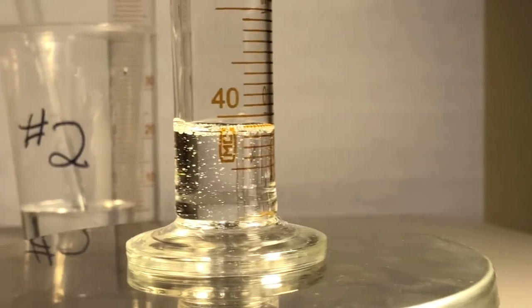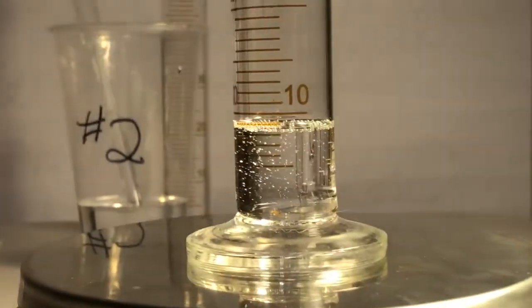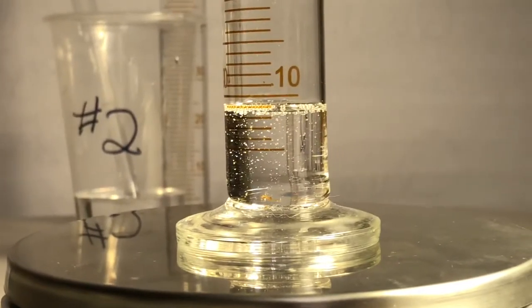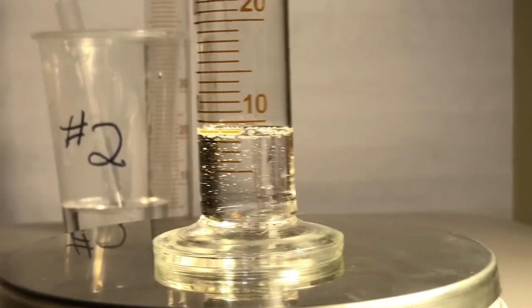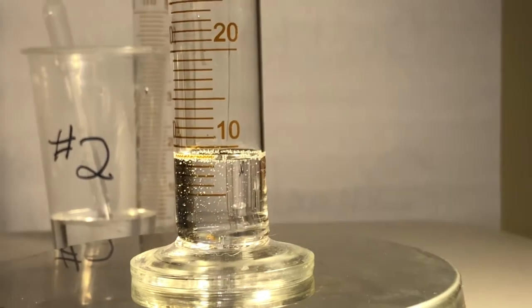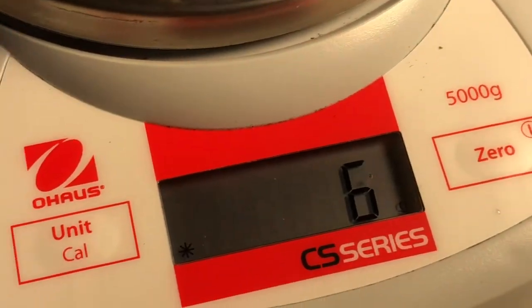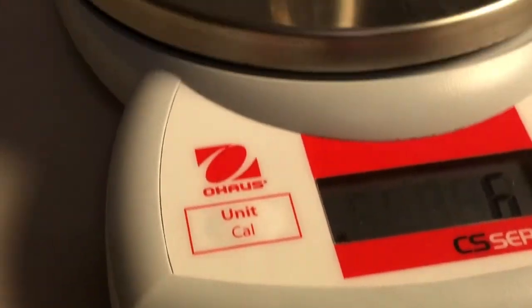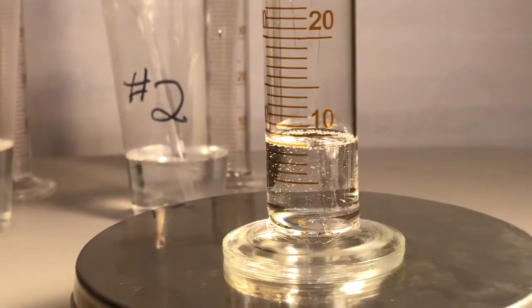Oh, I'm sorry, guys. They count up backward that way. Got to show you that side. Now you're happy, right? So that's a big fat line. How are you going to read that? You've got to make a call. Be a scientist. 5, 6, 7, 8, 9. Somewhere between that and that. What are you going to call it? But this, you're going to call easy. Easy peasy. How many grams? You got it. Here comes data point number 2.